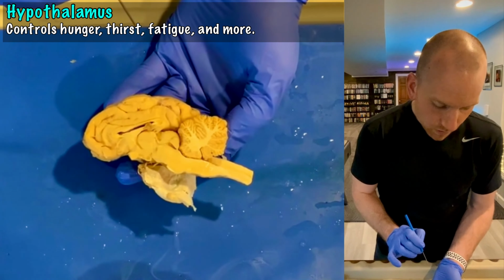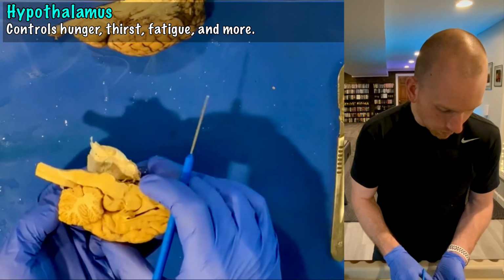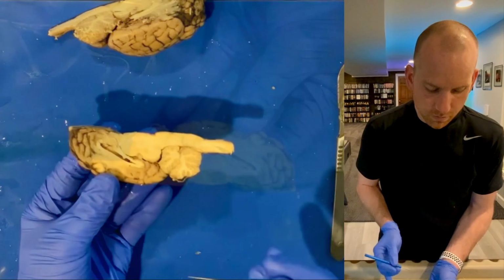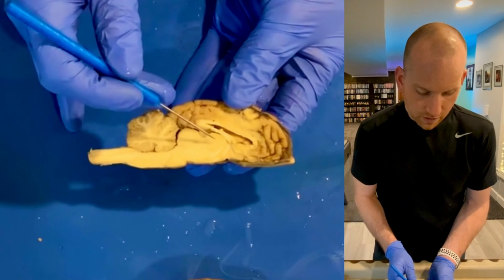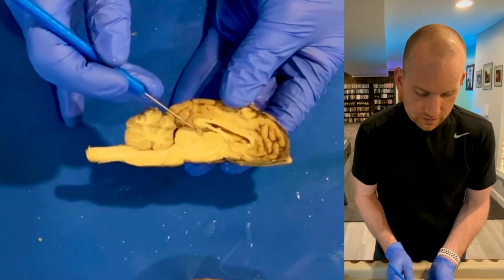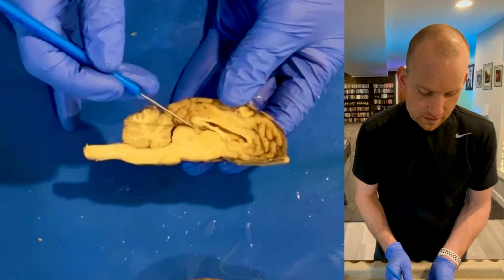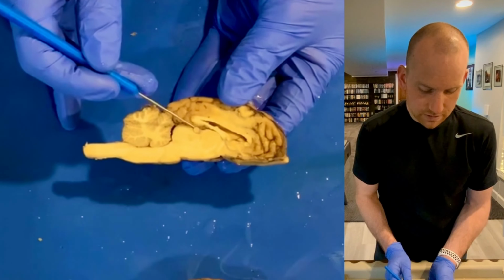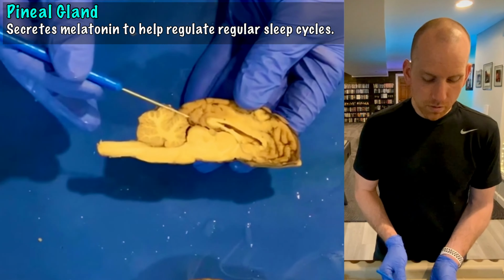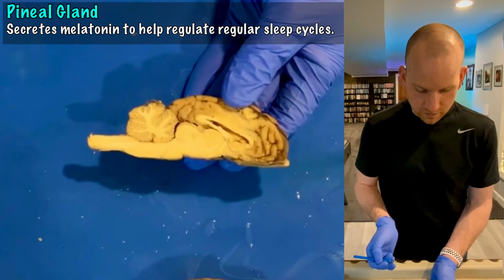And then one other structure, now on this one, it looks monstrous, but I'm not talking about that structure. So I'm going to see if I can point it back out on this brain. Here we go. So if I go back to our brain that I was looking at just a moment ago, and I find the thalamus again, right in the middle, right behind the thalamus, there's this little teeny structure right here. Look at how small it is. You'll notice it does kind of look like a little pine cone, and that's what gives it its name. That right there is the pineal gland. And the pineal gland, remember, the purpose of the pineal gland is to secrete melatonin, which helps with our circadian rhythm and our sleep cycles.